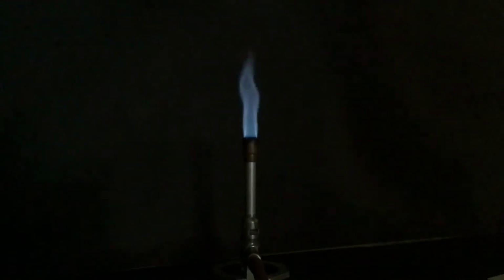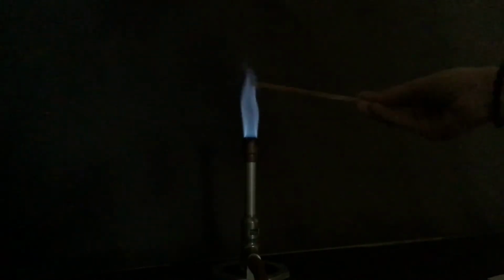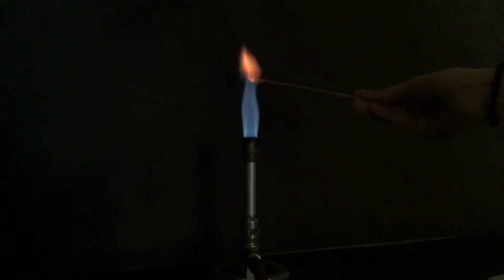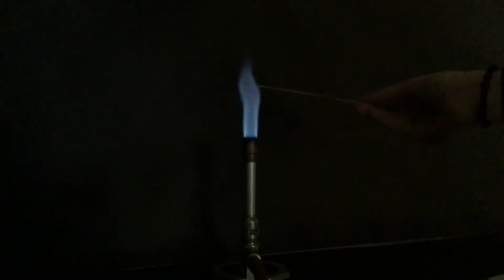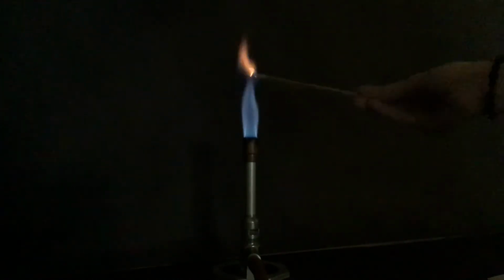The third substance that we're going to be testing is calcium, Ca, +2 charge. And you'll see that some of these are pretty similar, right? So you need to look at how the substance is behaving in the flame, some of the real big details about the color.